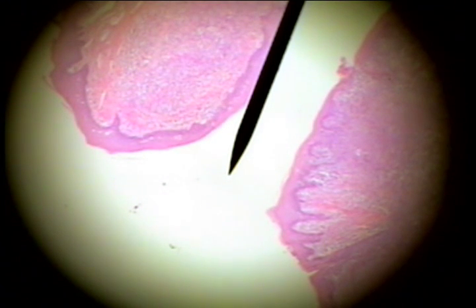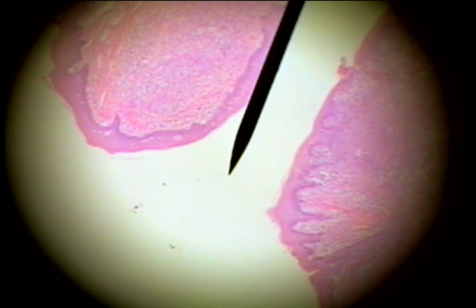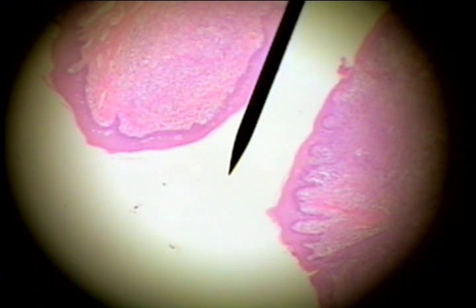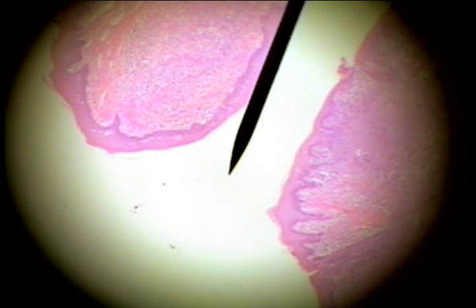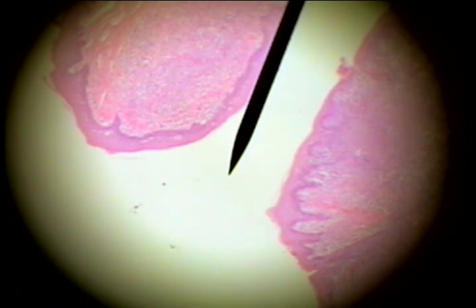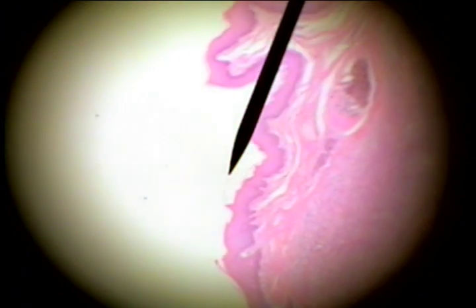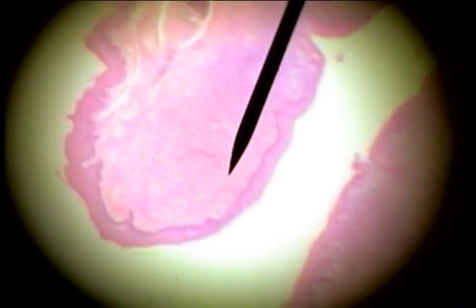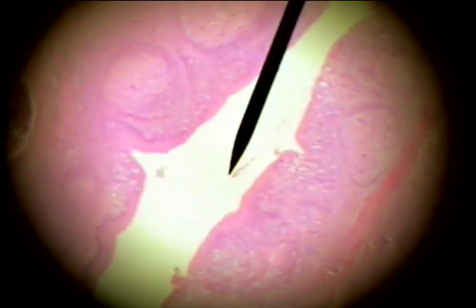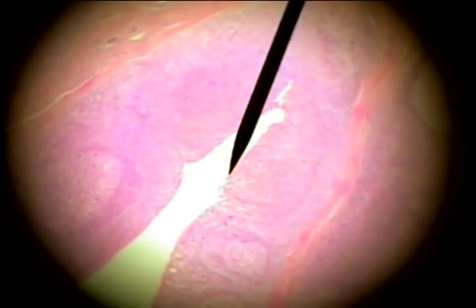This immune tissue is the palatine tonsil. This biopsy would have been removed from the posterior lateral portion of the oral cavity. The surface is wrinkled, and between each of these wrinkles or folds, these are called pits or crypts of the folded tissue. You can see there's a bottom of the pit here.